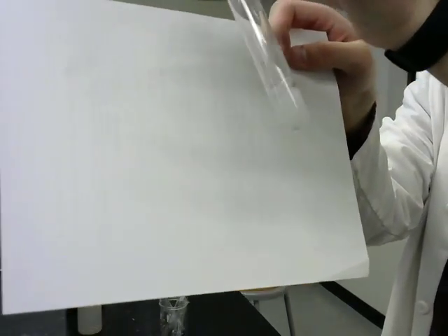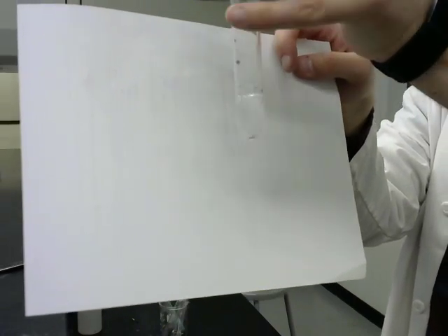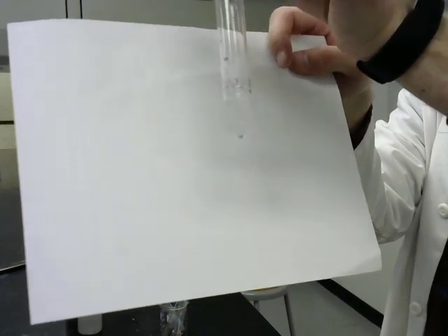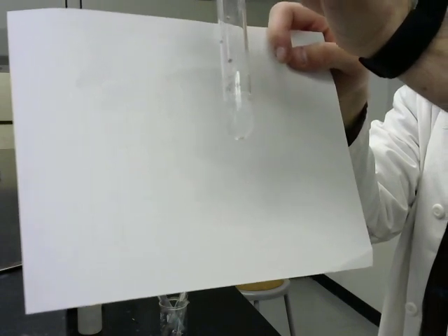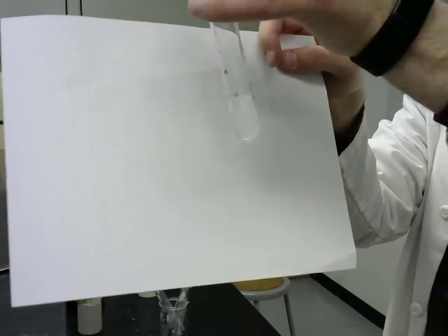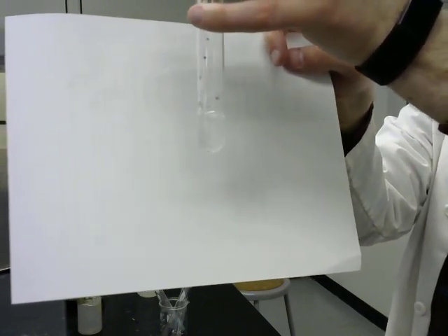So that is the zinc. It's already just about gone. That reaction was so rapid. It's starting to wind down, and there is no zinc left except for little tiny particles, little leftovers. Before too long, there won't be anything left.